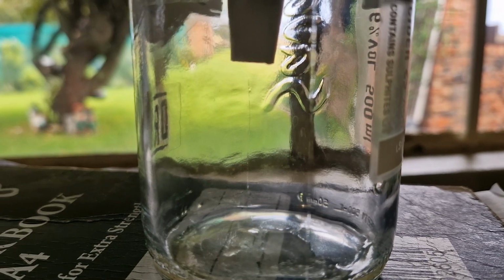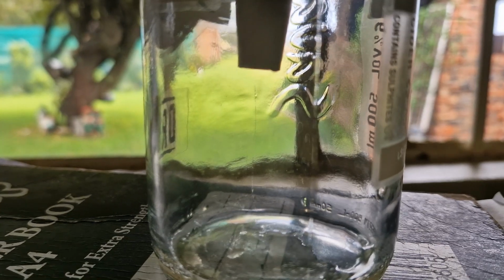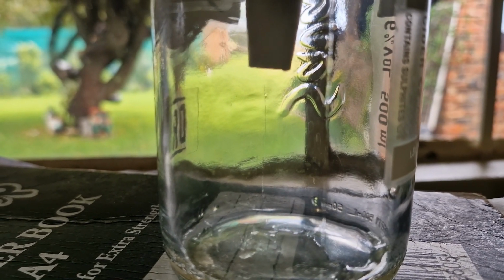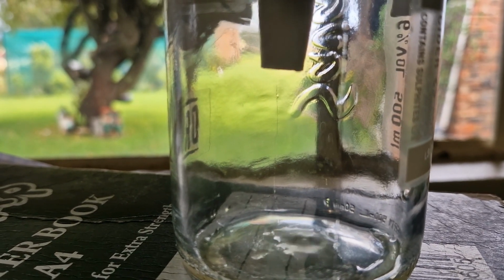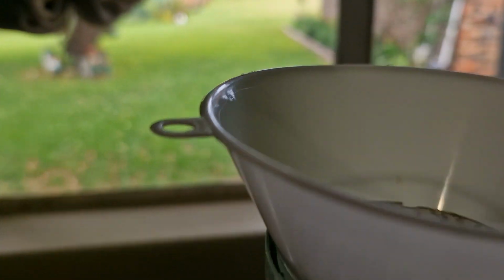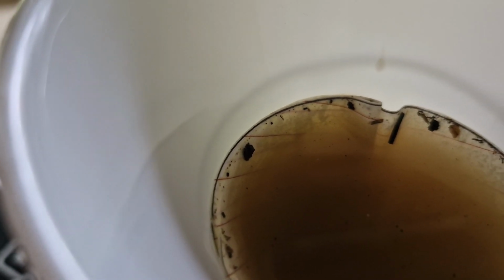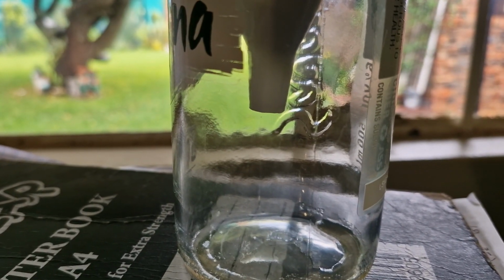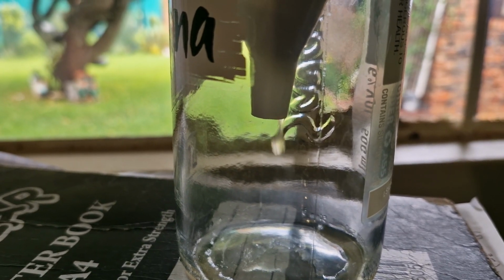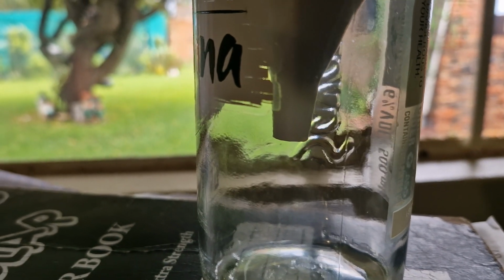So after you do that step, you start seeing that the sugar in water, or the sugar solution, is starting to drip into my second glass from the funnel. So I have here, as you can see, that sand and water and sugar solution, and I've used the filter paper to separate the two. And there you are. You see it is starting to drip. Those are the drops that you saw drawn in your sketch.